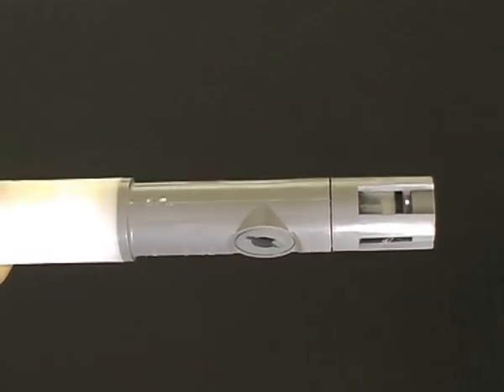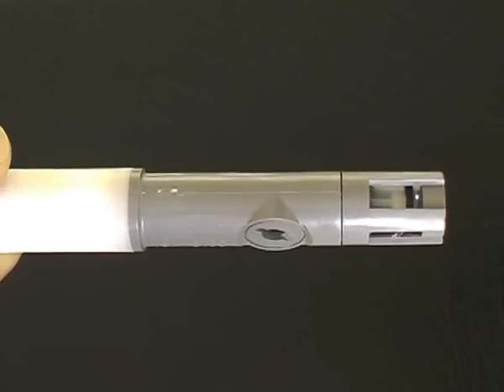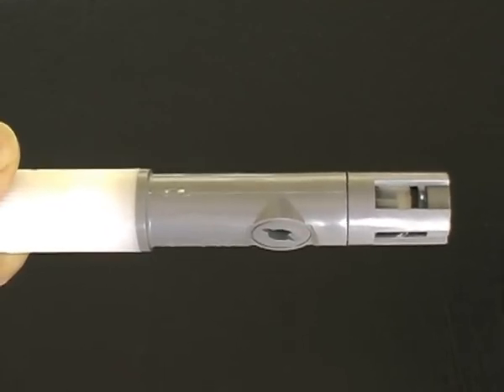The dissolved oxygen sensor requires a stirrer connected to it to move water past the sensing membrane for long-term deployment.